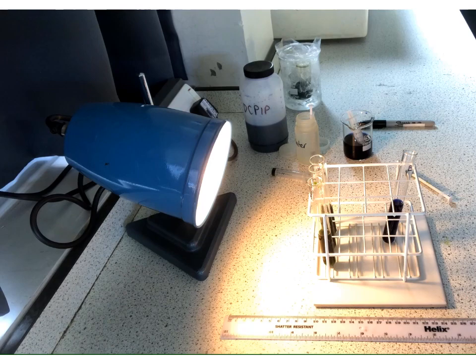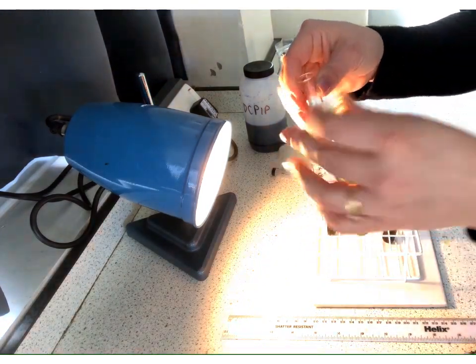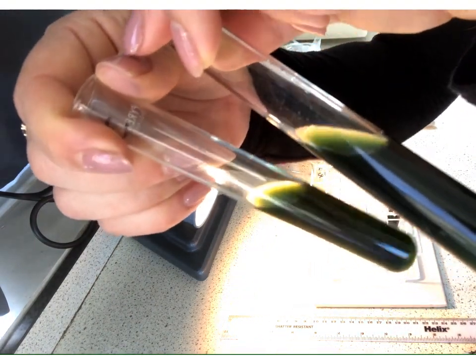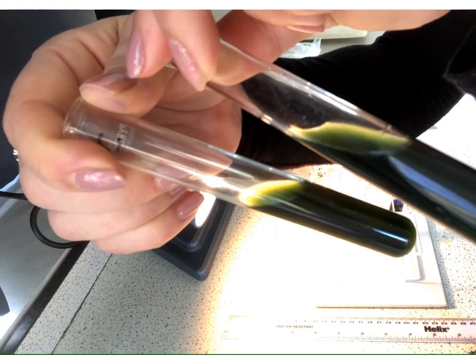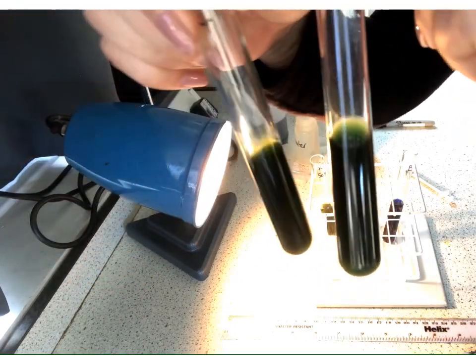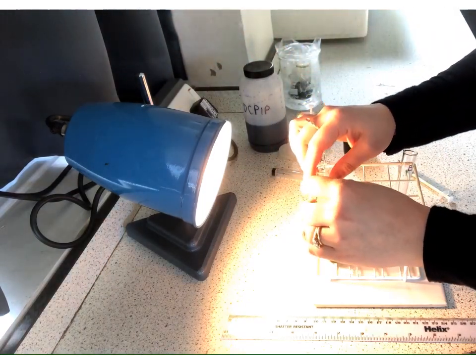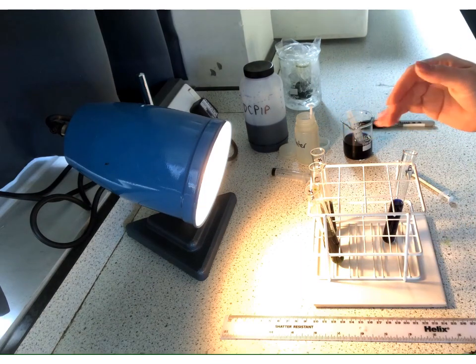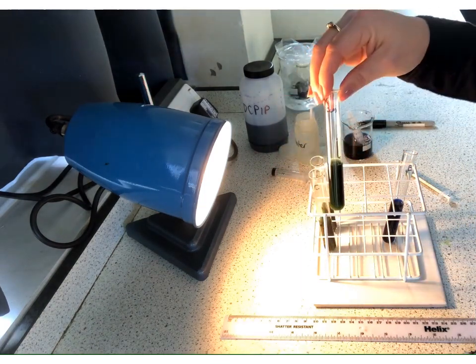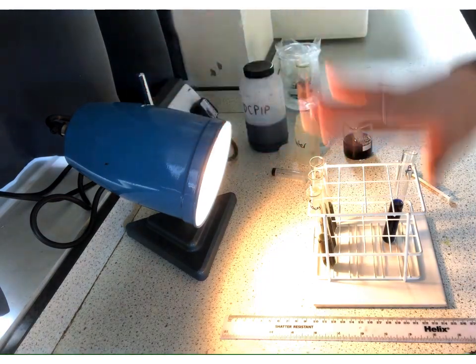Stop. Okay, we'll see if you agree with me. If we look at these two, I think we can agree that they are both a similar level of green, but as I say, we know that this isn't the best way to judge. So those were our two different distances. That was a high intensity at 5 centimetres and a low intensity at 10 centimetres. That's how we have changed this. We've tried to keep everything else the same.